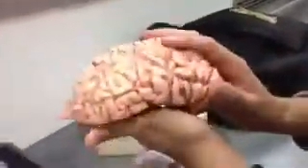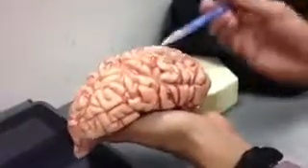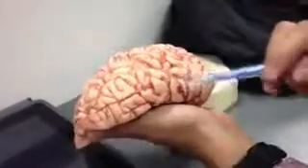The principal speech area is called Broca's area, and you could find it in the frontal lobe, somewhere around here. Broca's area, principal speech. Parietal lobe, we just talked about it. It's the postcentral gyrus behind the central sulcus. Temporal lobe would be on the side, and it's associated with the auditory area. So you have your lateral sulcus coming in, separating the parietal from the temporal, and you have your primary auditory area somewhere around there. And then the occipital lobe in the back, you have vision in the back.